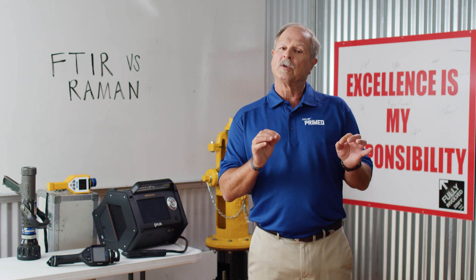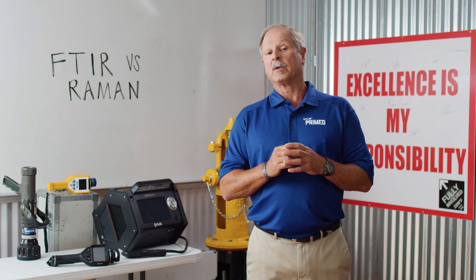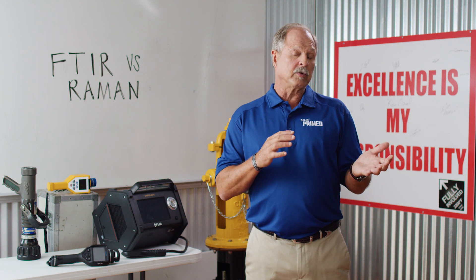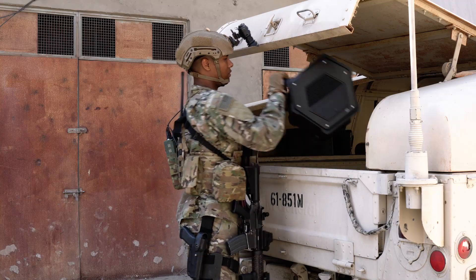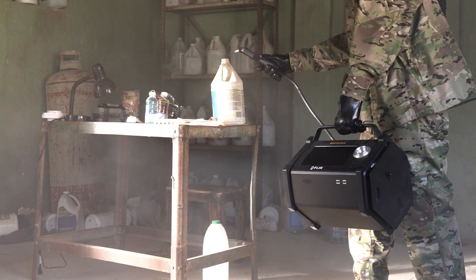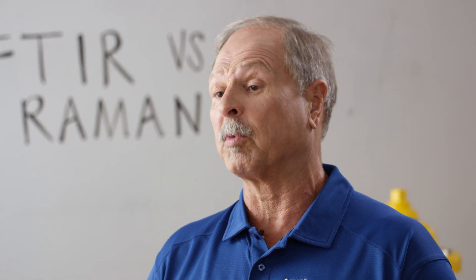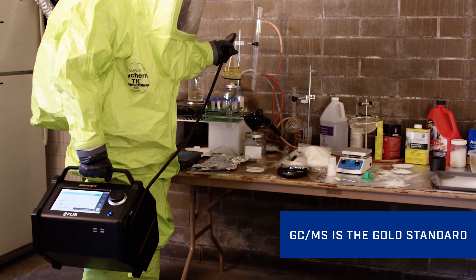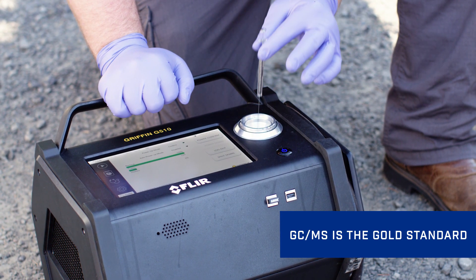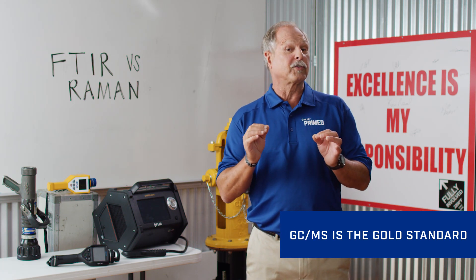In previous episodes, we've covered various tools that can help with chemical ID — from field indicators like placards and labels to electronic sensors. There are confirmatory identification tools like GCMS that can be used in the field that tell us with specificity the exact chemical, not just the general family a chemical belongs to. While GCMS is considered the gold standard for confirmatory identification for bulk and trace samples, not every HAZMAT team is equipped with this versatile tool yet.